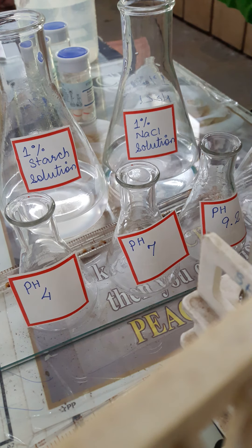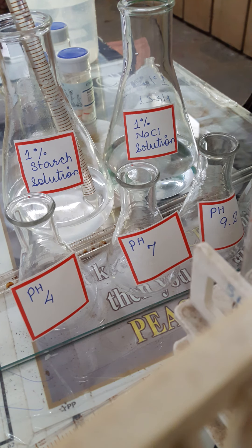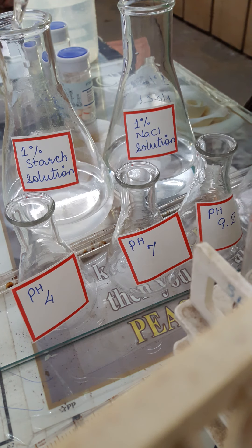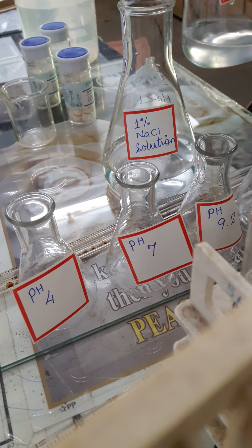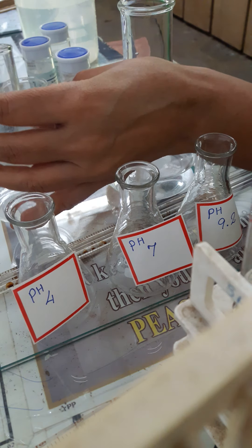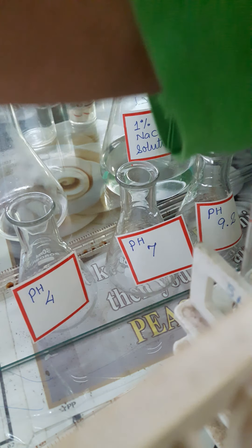We are going to take 15 ml of starch. First I will add 10 ml with the help of a 10 ml pipette. You can see 10 ml of starch being added. Now some more 5 ml — I have now taken 5 ml of 1% starch and I am adding it into the mixture flask.